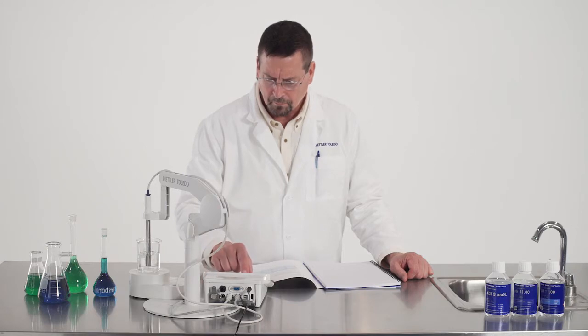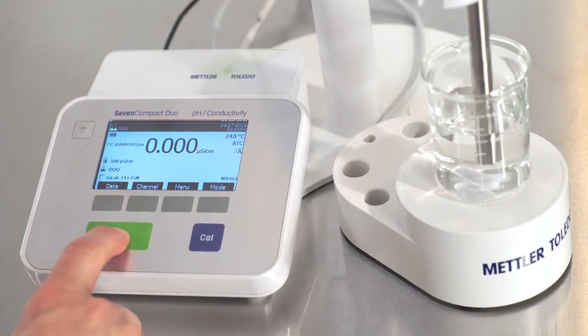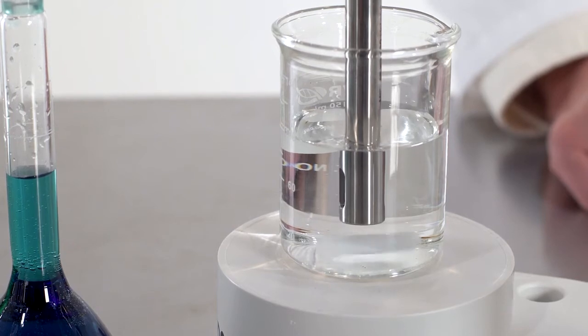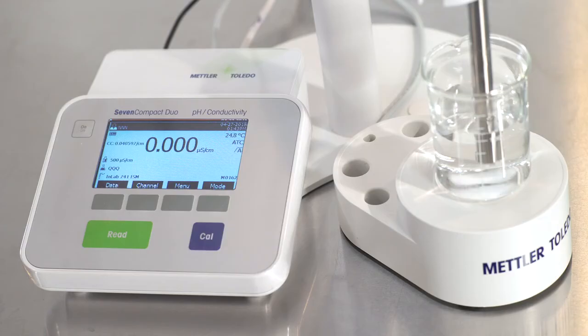Stage 2 now requires each measurement to be performed at 25 plus or minus 1 degrees Celsius. Once the temperature is stable, the sample must be stirred and a conductivity measurement taken. This measurement must remain stable for 5 minutes. Here is another opportunity for error if the measurement or temperature are not stable or the conductivity measurement is read incorrectly. In this case, the sample passed on the second step.